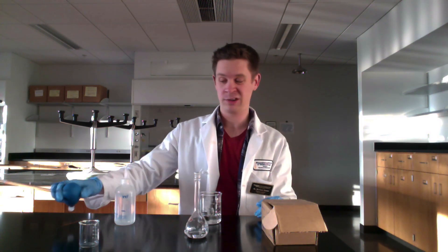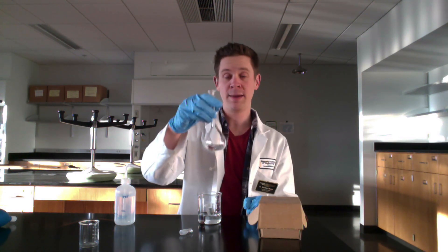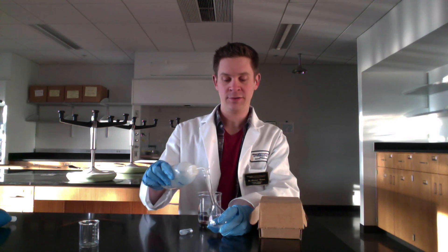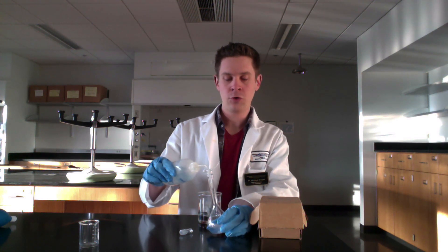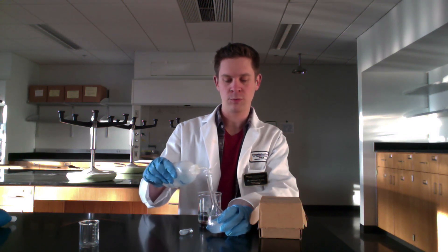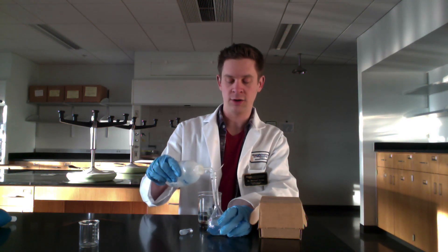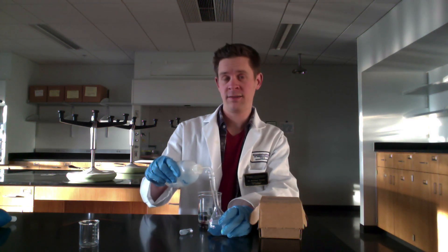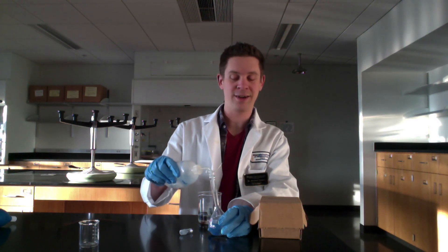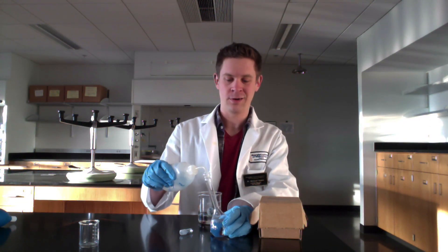Now we're done with the serological pipette. We'll use the volumetric flask to do all remaining liquid measuring. All that remains is to add solvent, so we use the wash bottle of deionized water. Don't worry yet about making the solution uniform — just keep adding water until you get close to but not all the way to the marking on the volumetric flask. You can use the faucet or deionized water tap, but be very careful not to overshoot the line, because if you do, there's no choice but to start over.